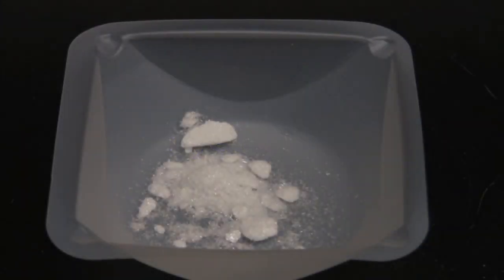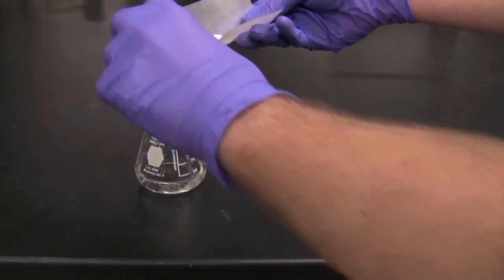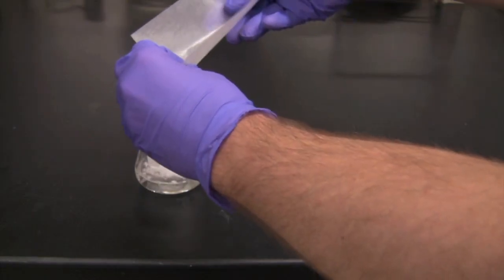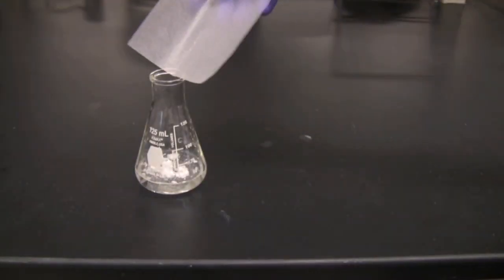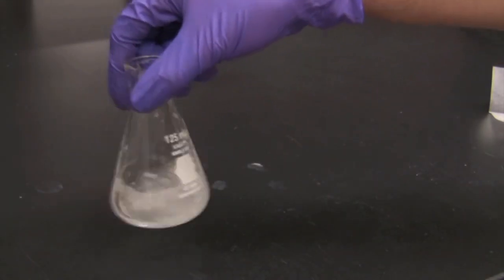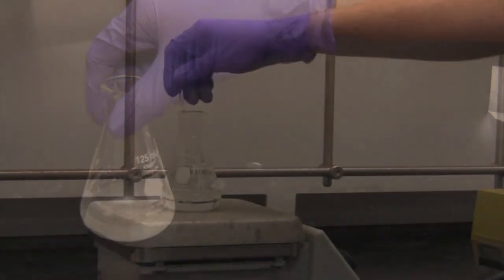Recrystallization is a process used to purify solid compounds. First, a solvent is selected for which the desired compound has a low solubility at room temperature and high solubility at high temperature.